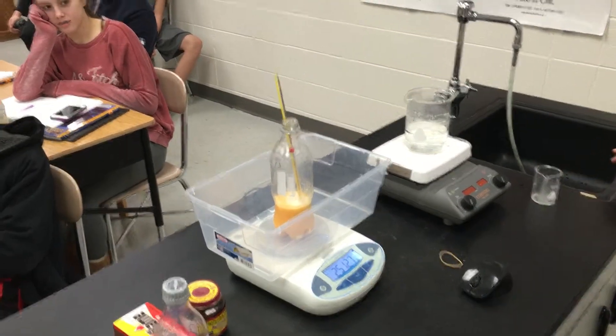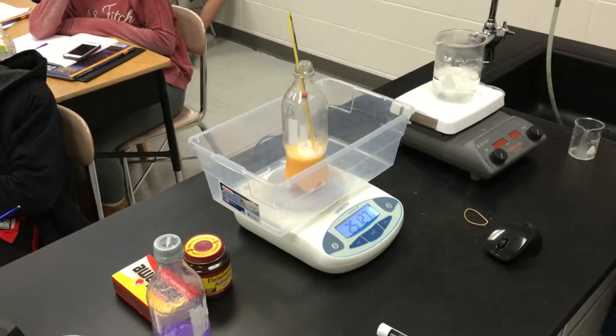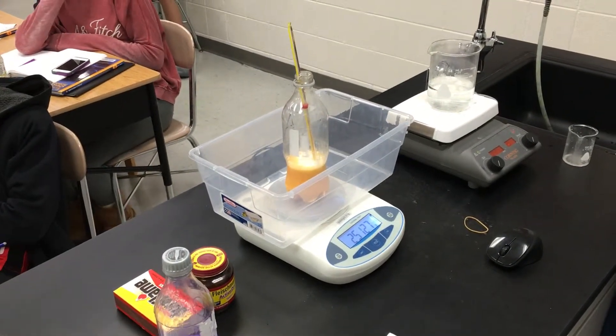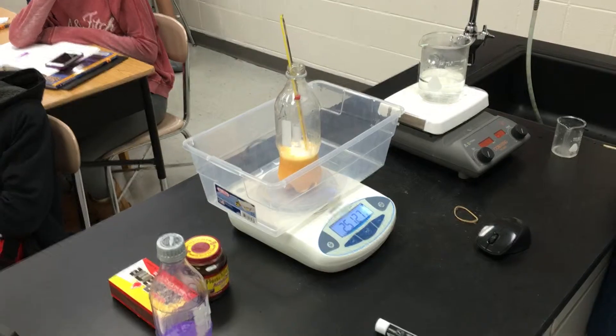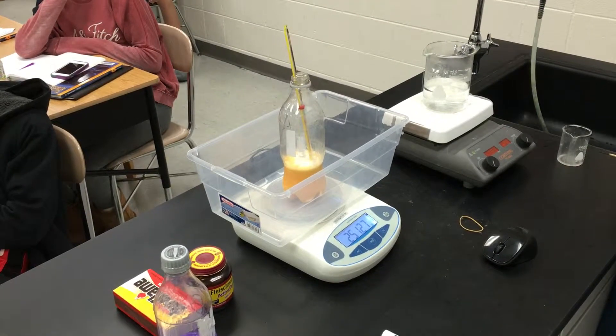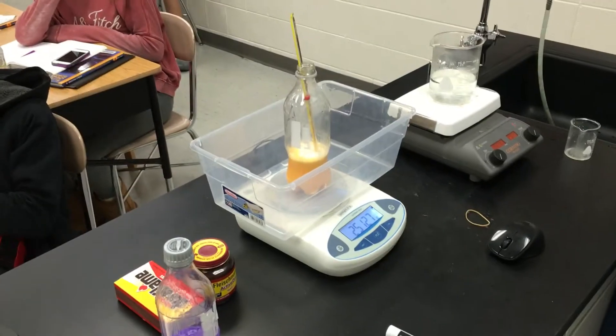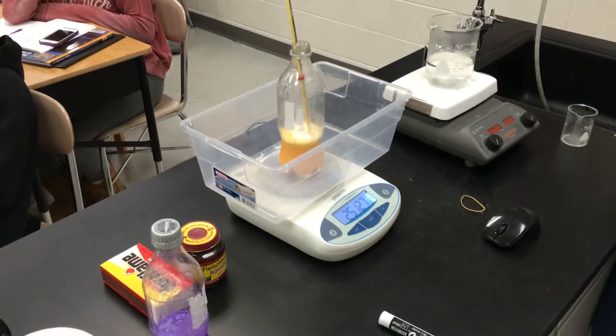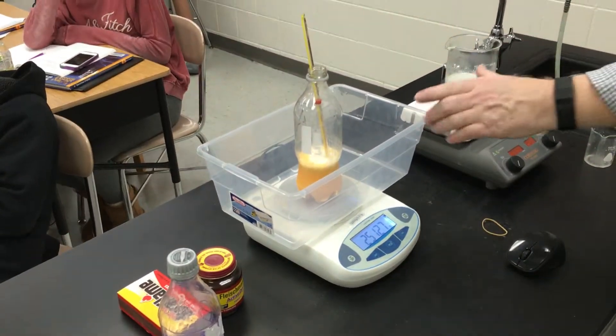Nothing is happening yet. It's not working yet, it will take time. Nothing is happening. Nothing is happening. Oh, there's something happening, zoom in.